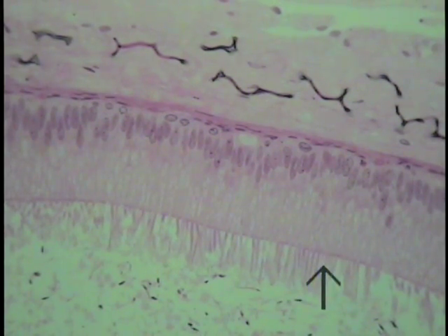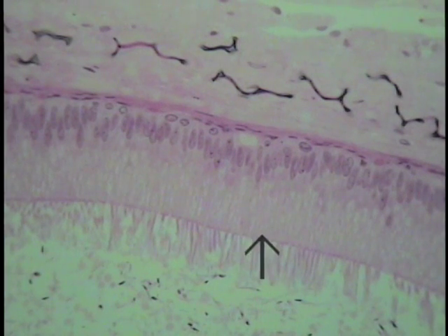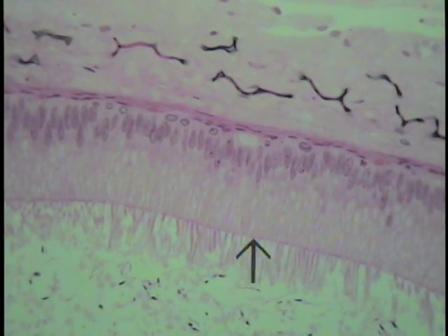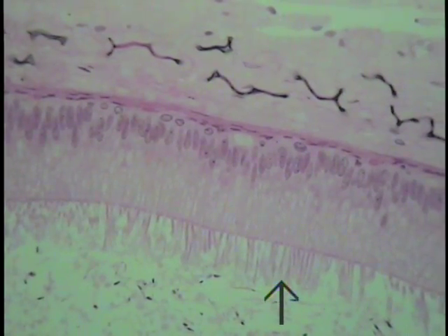These are oftentimes clumped together and form these wisps coming out from the apices of the cells. These are the so-called stereocilia, a highly branched form of microvillus, not true cilia, they do not beat, but are increased surface area once again for absorptive capacity, but have been given the name stereocilia. Look at these structures at increased magnification.